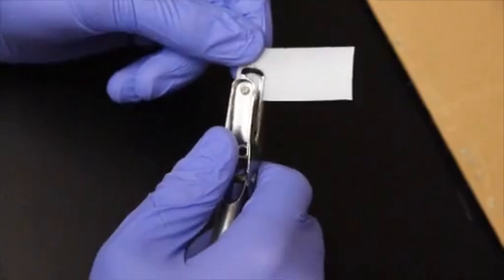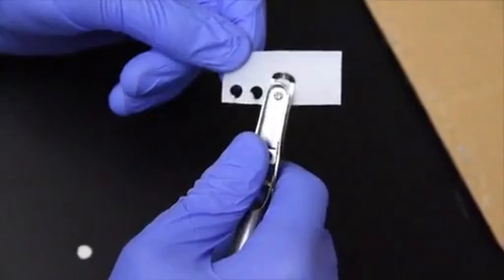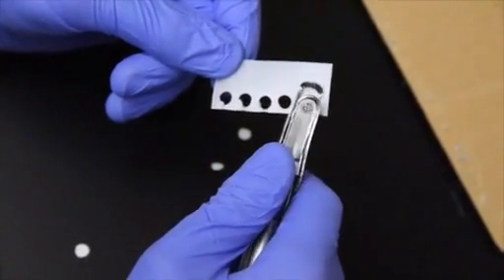The first step is to make the markers that will be placed on the animal's hind limb. The reflection of light off of these markers allows the coordinates of anatomical points on the leg to be extracted from the videos. To begin, punch the desired number of circles from the sheet of reflective paper. Each mouse requires 5 markers per recording, 2 large and 3 small.